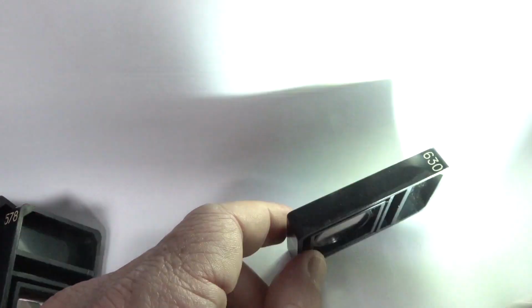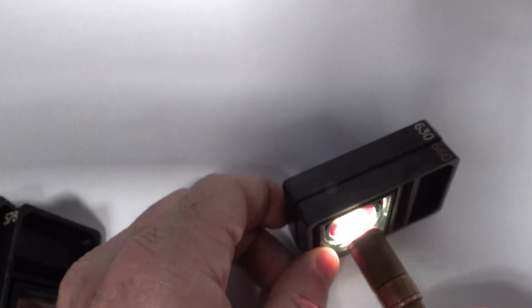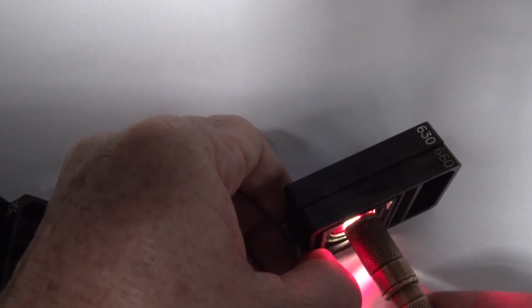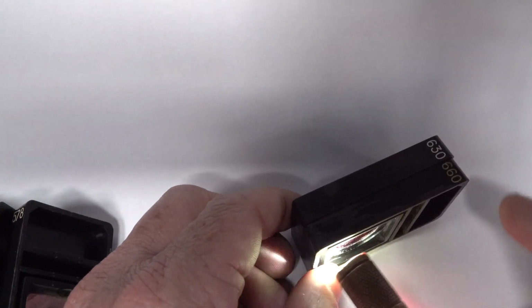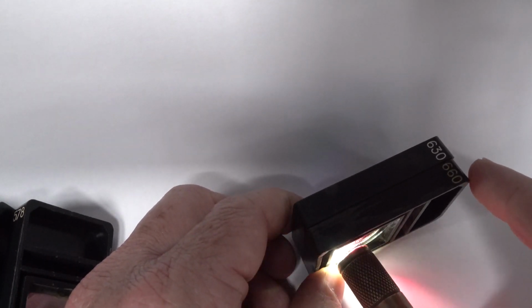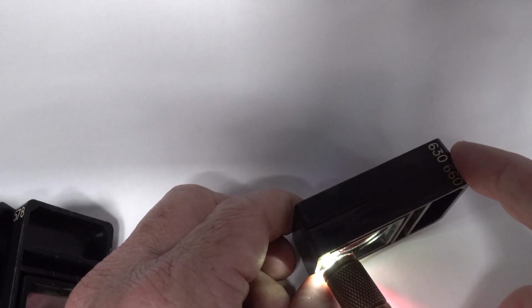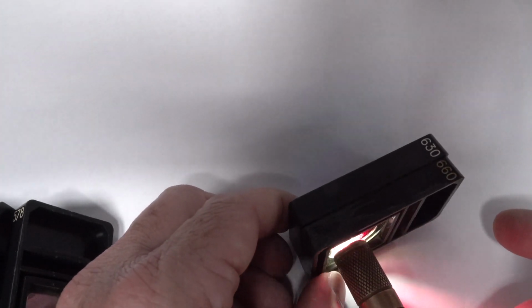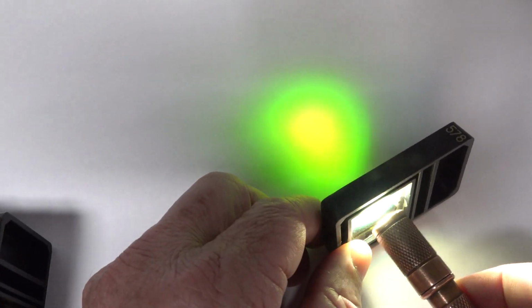Let's go back to our 630. That's slightly different. But let's see what happens if we take 660 and 630 and shine it through. Look, nothing gets through at all. I can't see anything. That could be light leaking from somewhere else, but it basically doesn't get through. So that means it's no wider than 30, because it's got to be 630 plus 15 and 660 minus 15 to stop everything getting through. So it looks like something less than 30 nanometers. Now 578. Isn't that groovy? I like that.